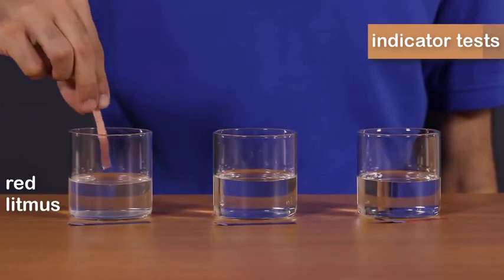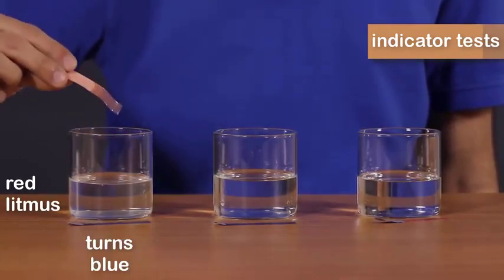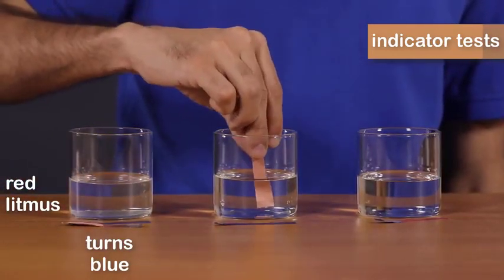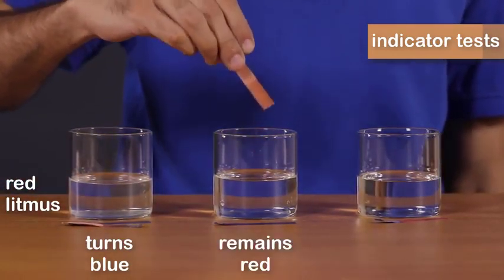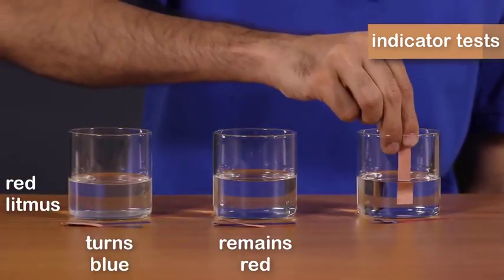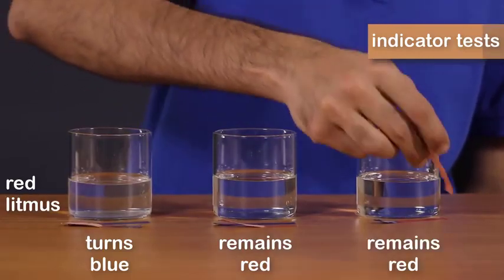So in the first solution, as you can see, the red litmus paper turns blue. In the second solution, there's no color change here. And in the third solution, again, there's no color change. It remains red.